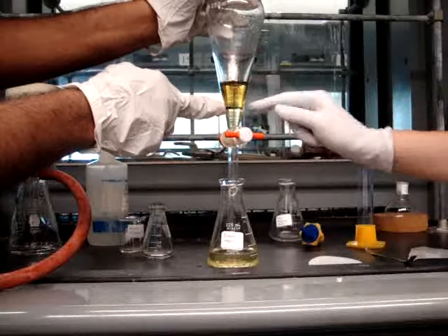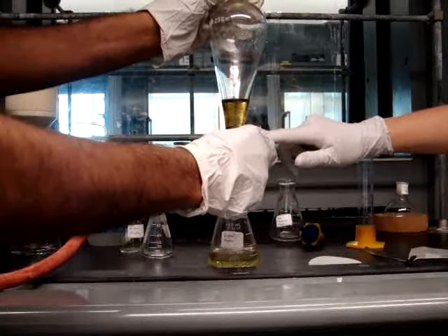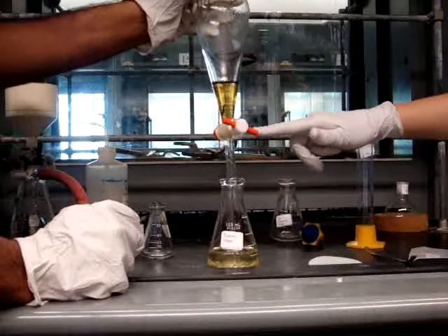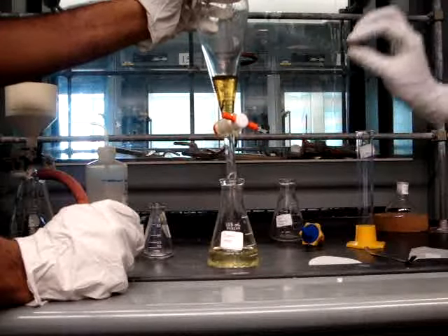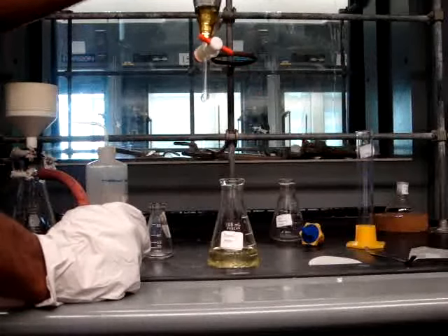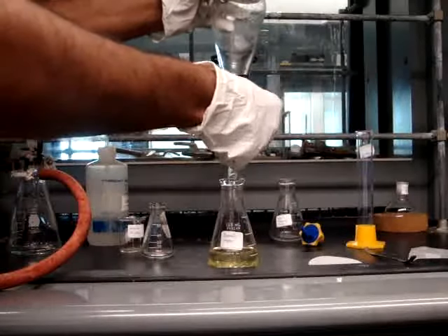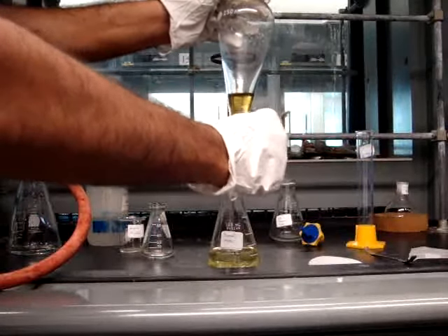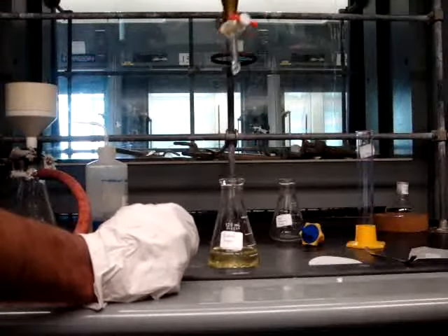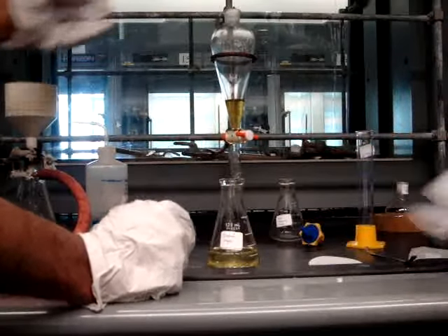As you can see here, you have some emulsions that have formed, and these again are the tiny droplets of one phase partitioned in another. Emulsions can be gotten rid of by either waiting, because eventually they'll separate, or since we have limited lab time, you can add more of your organic solvent or saturated sodium chloride, or you can filter the entire liquid over a diatomaceous earth. Whatever your TA suggests is the best method for the emulsions that you have should be what you should do.